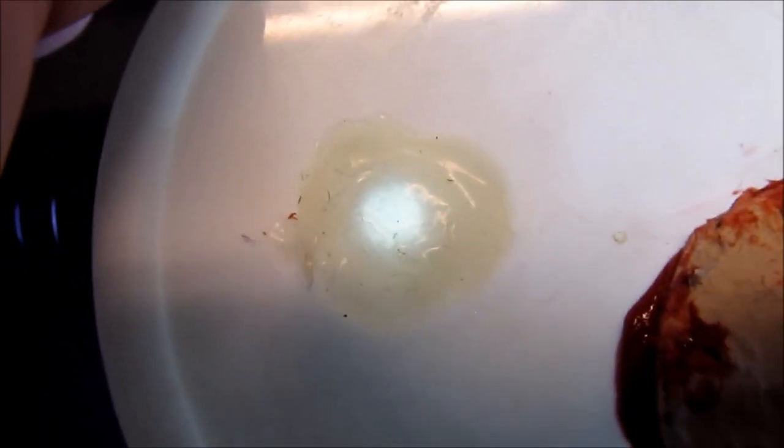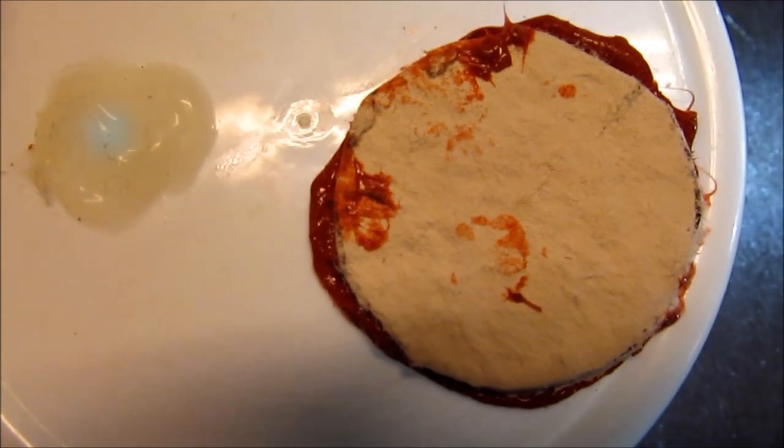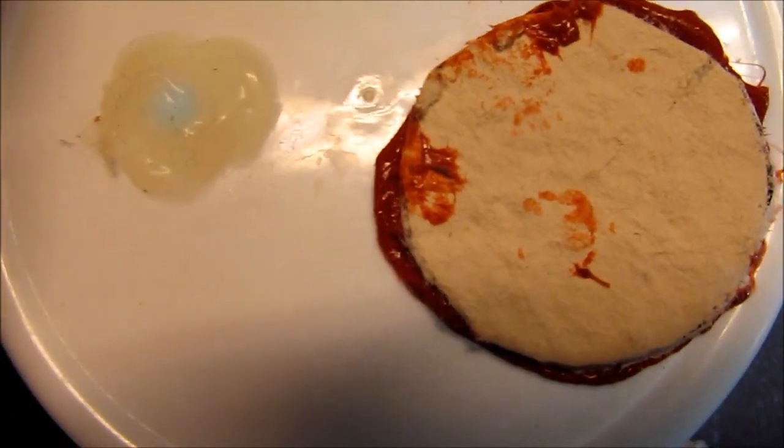The one on the right has silicone - a little blob of silicone. They also go through the hole and there's another blob on the top. They give you a self-healing injection port. Your syringe full of liquid culture or liquid inoculant goes right through that and lets you inoculate without having to open the jar, which is really nice.